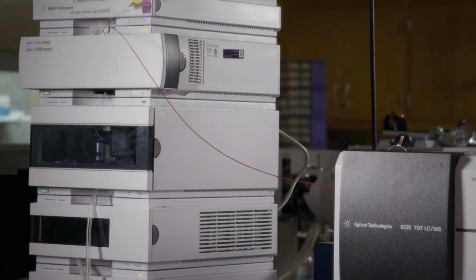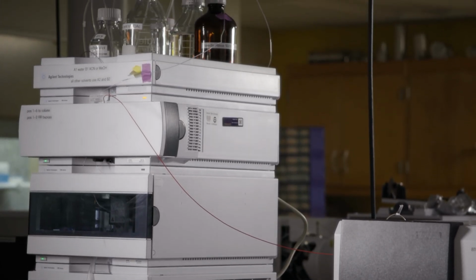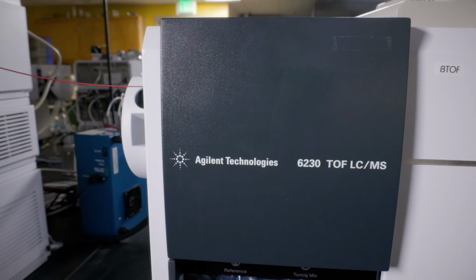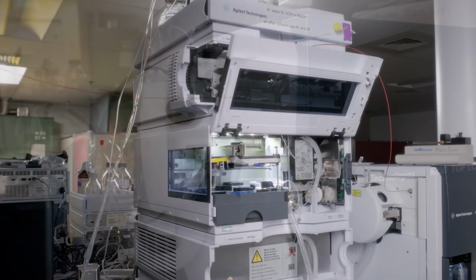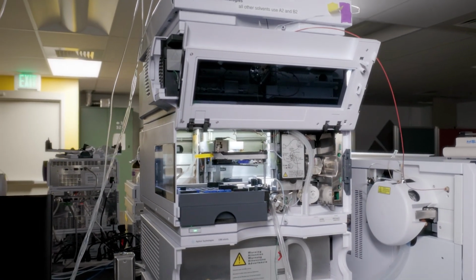Agilent 6230 LCMS is one of many mass spectrometers available here at the ArcMMA that may aid you with your research. If you would like to be trained as a walk-up user, we have more instructional videos to assist you. We also provide full-service mass spectrometry analysis on this and every other mass spectrometer in our lab, where a staff member can prepare and analyze samples for you.